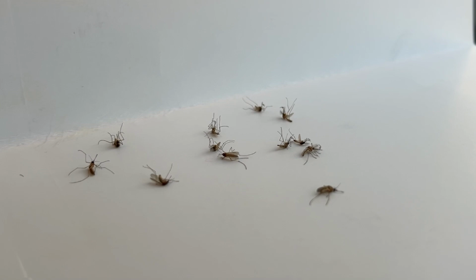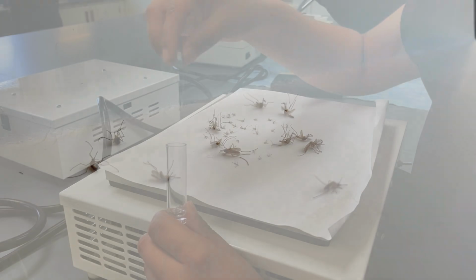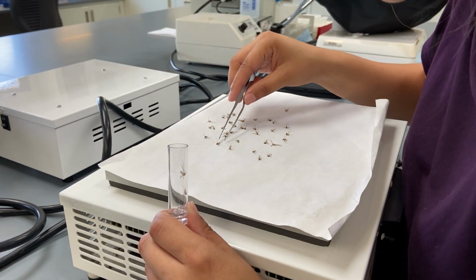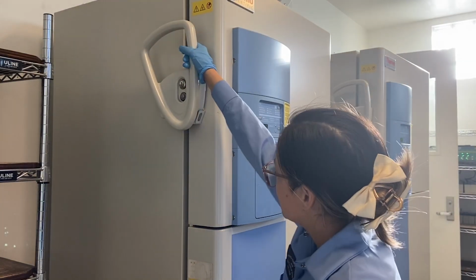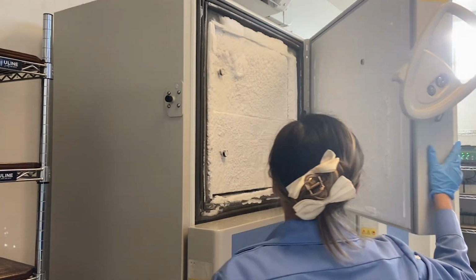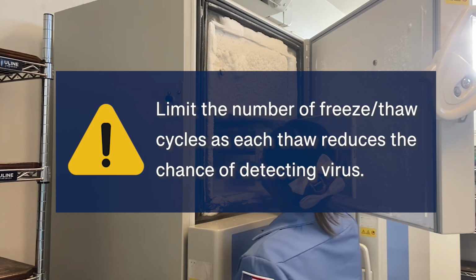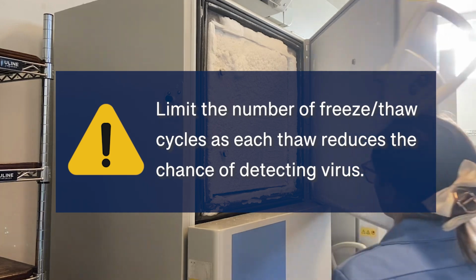Anesthetized mosquitoes can be held alive in a refrigerator at 4 degrees Celsius overnight, if all mosquitoes cannot be counted on the day of collection. Regardless of the initial method used for knockdown and sorting, all mosquitoes for arbovirus testing should be frozen at -80 degrees Celsius after sorting while awaiting testing. It is important to limit the number of freeze-thaw cycles, as each thaw reduces the chance of detecting arboviruses in the mosquitoes.